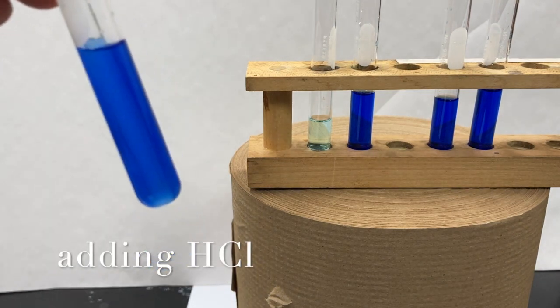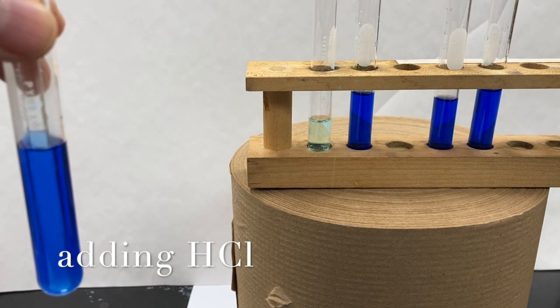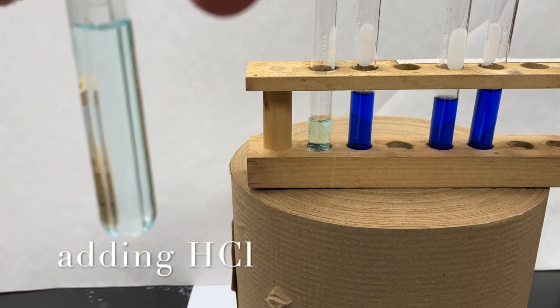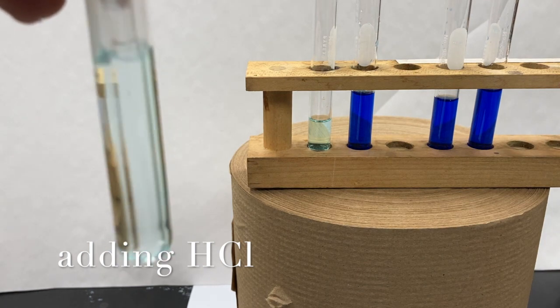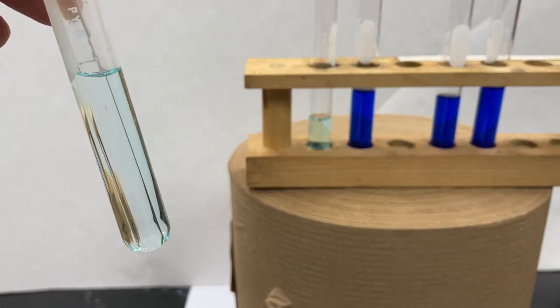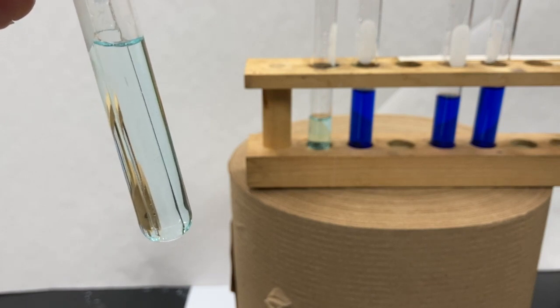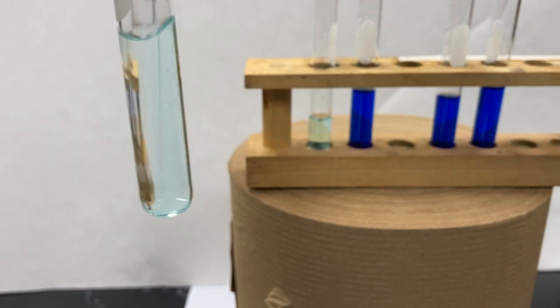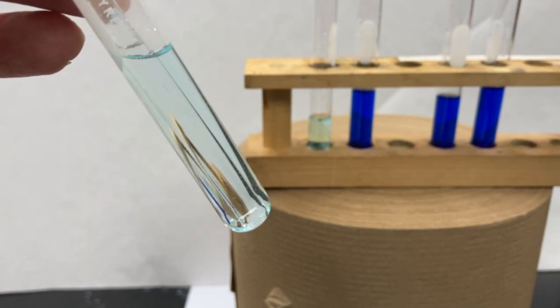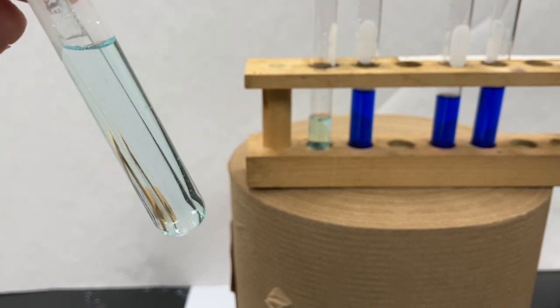Oh, we're no longer as deep blue as we were. Oh, we saw precipitate, which means we went back to the cloudy, and then now it's the translucent blue again. So we basically brought it back to its original state. It went through two stages. Right? It went from the deep blue to the cloudy, opaque, light blue to the clear light blue with the addition of HCl. So that would be two separate reactions stepwise.